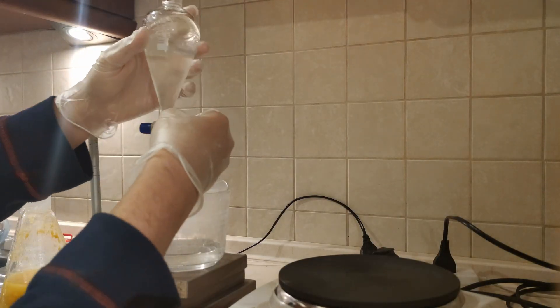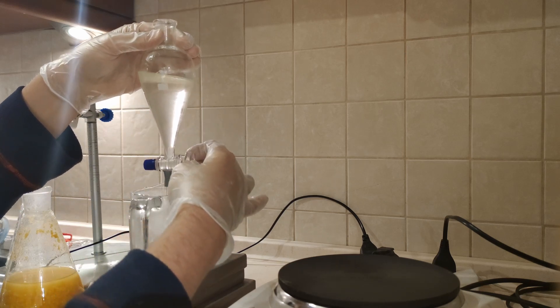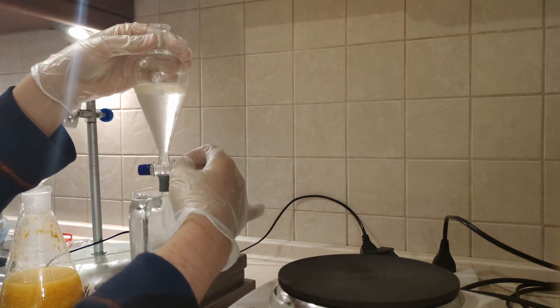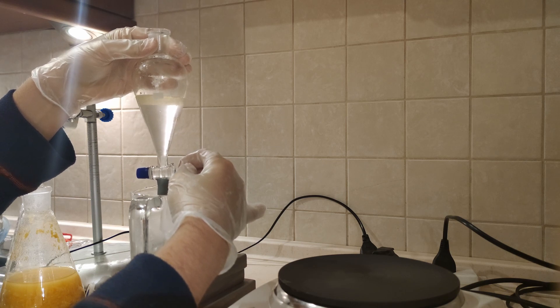After that I dismantled the apparatus and put the contents into a separatory funnel. I did a quick sodium chloride wash and drained off the lower water layer.